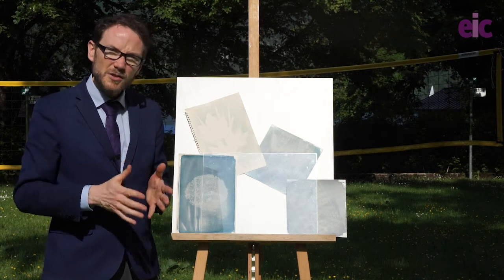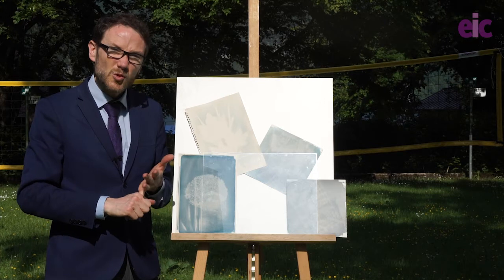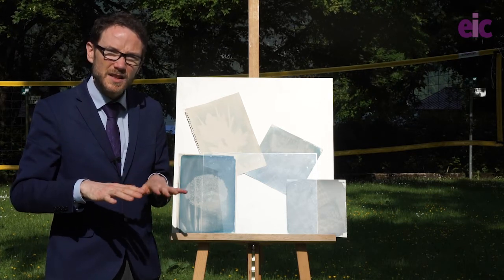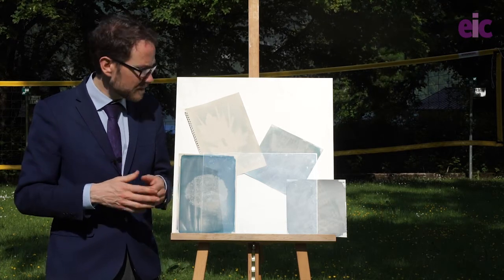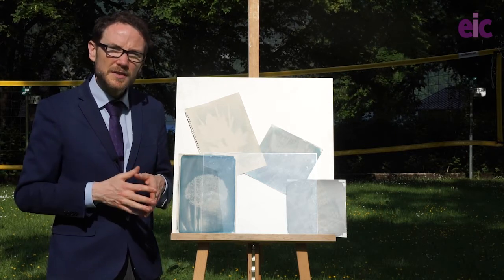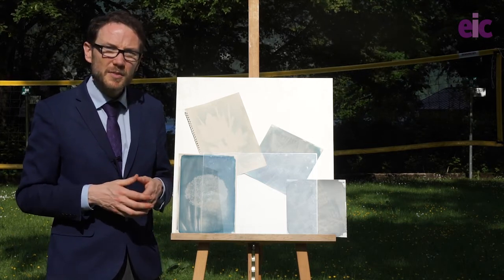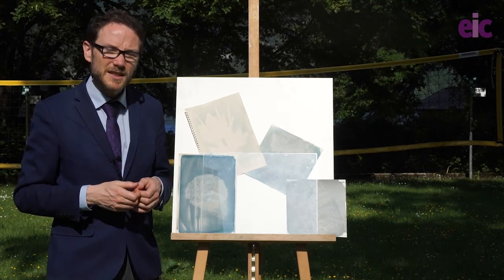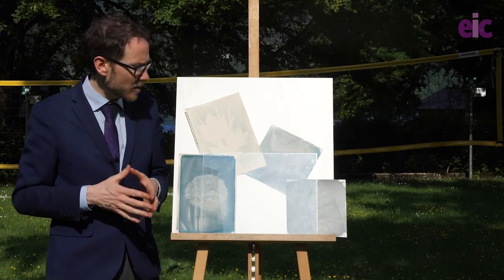So in terms of tips to make sure you're getting the best possible results: make sure your paper is as dry as possible before you start. If you can't wait, leave it on a flat surface and place objects on top of it that allow it to dry around them. And if it's not fully dry, make sure you leave some time for it to dry before you do the rinse off. Other than that, this is a pretty bombproof experiment. The other thing to make sure of is you really do need some strong sunlight for this to work in a sensible time frame, so have a think about that and time your experiment appropriately.